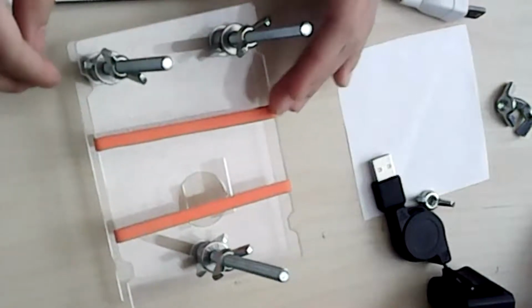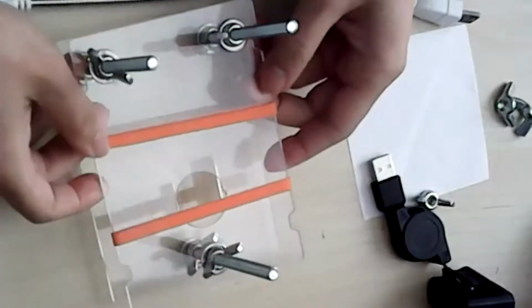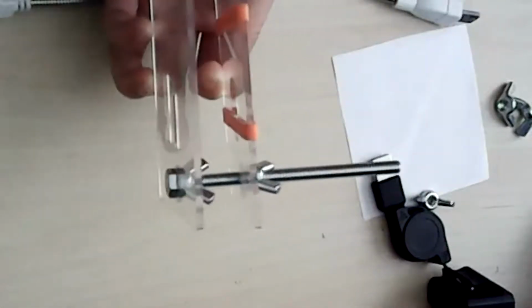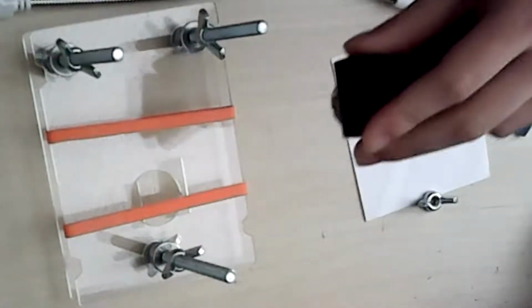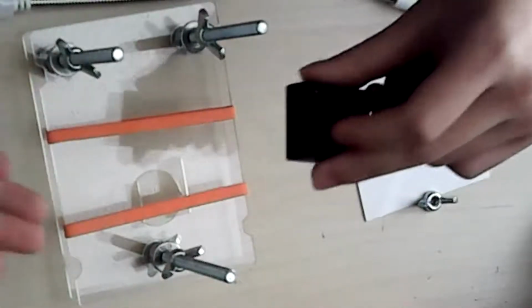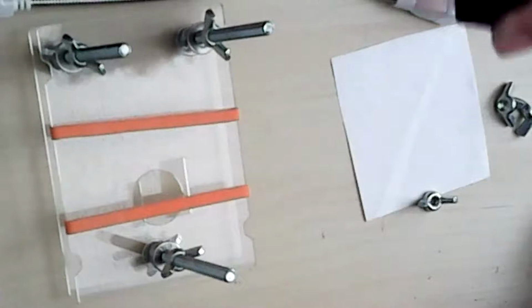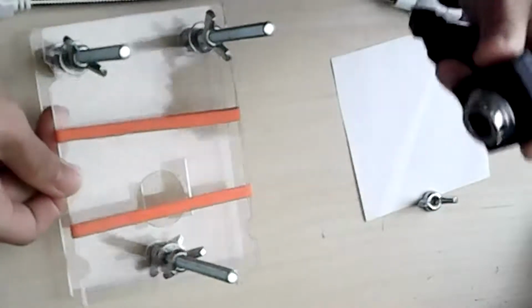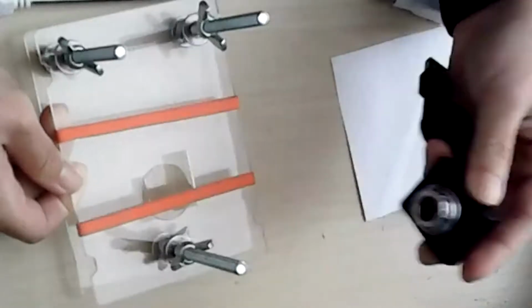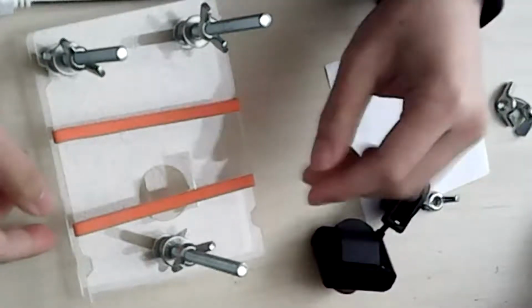Vanya, about how much space are you leaving between the top of the stage and those wing nuts you just put on? So I think approximately, your camera will essentially be 1 centimeter away from your specimen, and the top of the stage could be around 2 centimeters away because there's a little bit of space between the camera and the base here, and just this much space. So 1 to 2, around 2 centimeters on top, and it's obviously not going to be accurate the first time you do it, so you can just adjust it as you go.